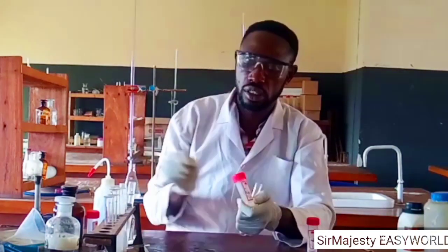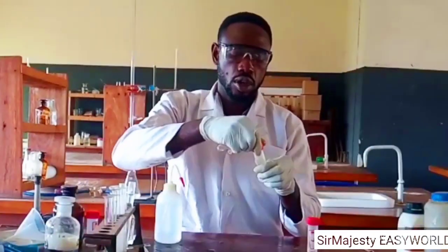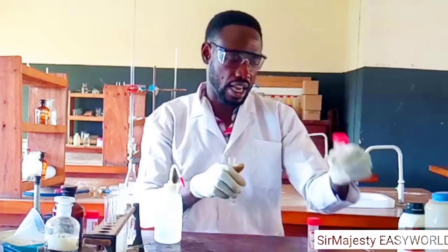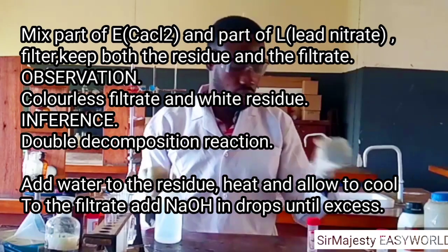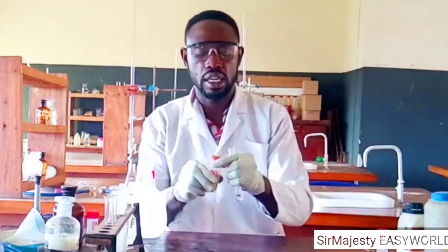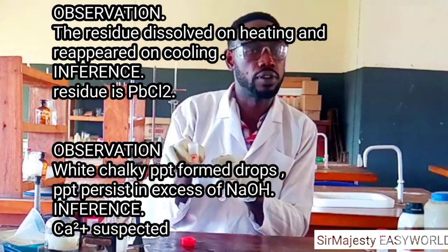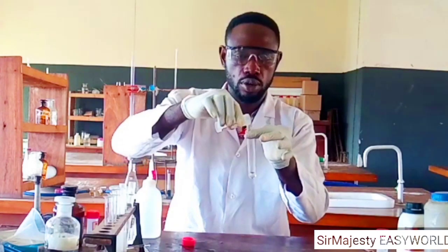That second portion of E is actually unknown, but I'm calling it by name so that you know that this is calcium chloride. I'm teaching you how to test for chloride ion. You can use lead nitrate to test for chloride ion by what I'm showing you now. If you add lead nitrate to any soluble chloride, there will be double decomposition, as I told you earlier. So you might also be told to measure a small part of L and add to a measured volume of E. That is trying to make double decomposition.